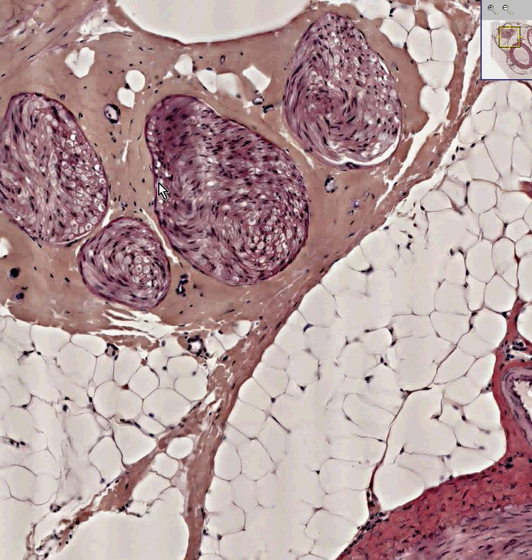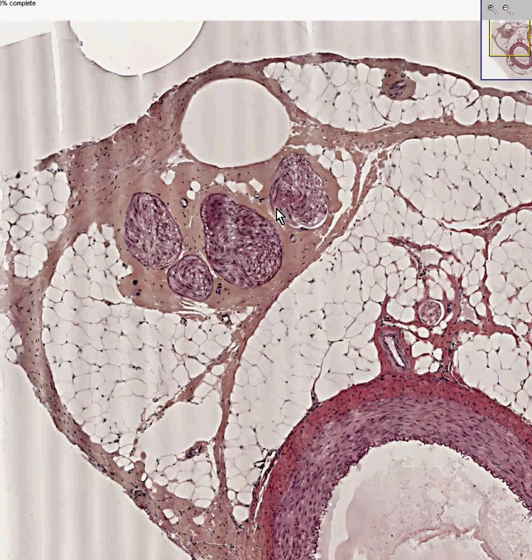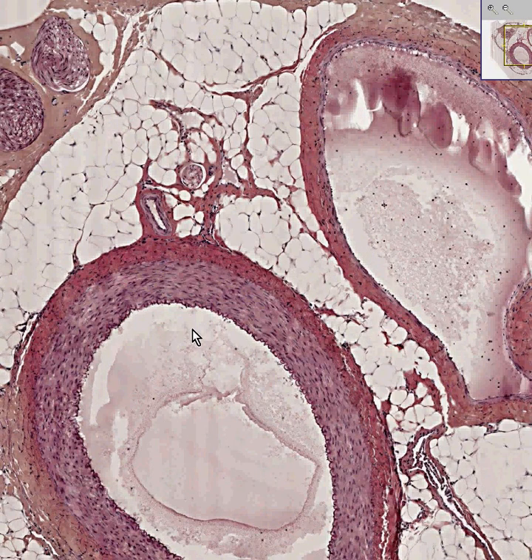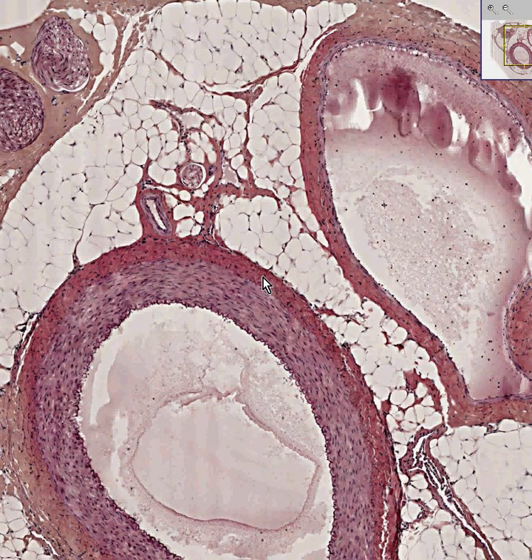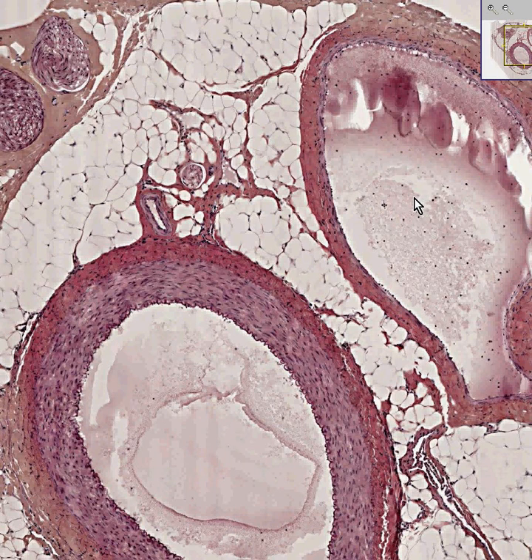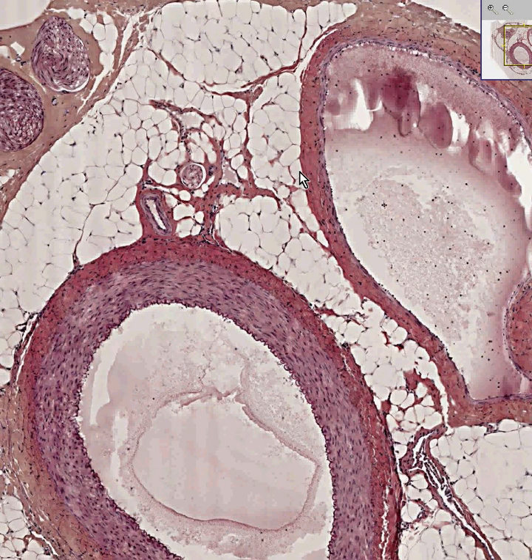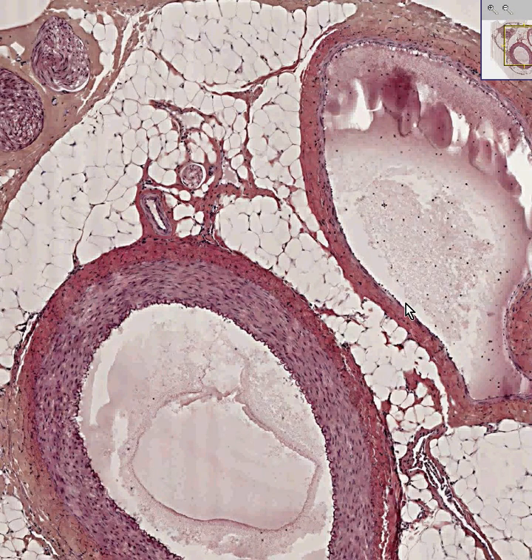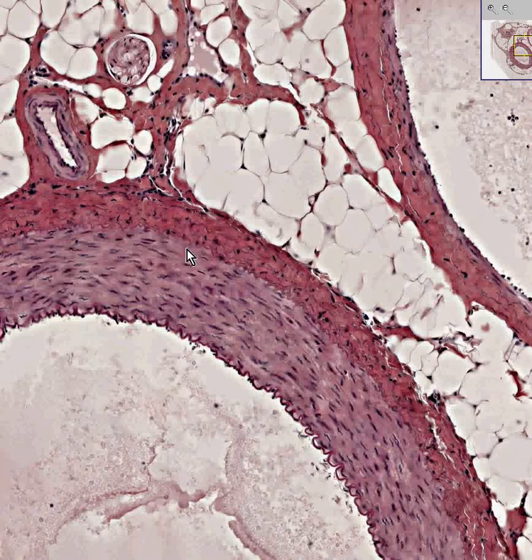So in review: here's the nerve part of your neurovascular bundle. Here is the artery part, in which the smooth muscle is thicker than the pinker adventitial connective tissue. Here is the vein part, in which the adventitia is thicker than the smooth muscle and has no internal elastic lamina, in contrast to the artery, which has a very profound, thick, squiggly internal elastic lamina.